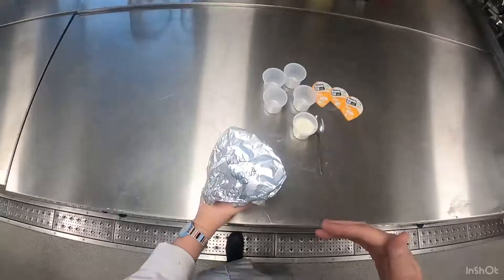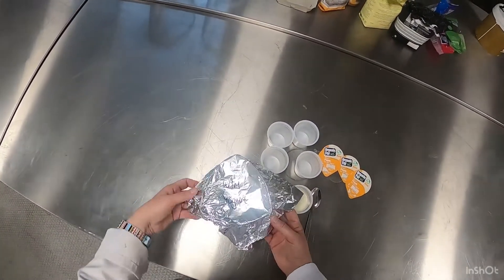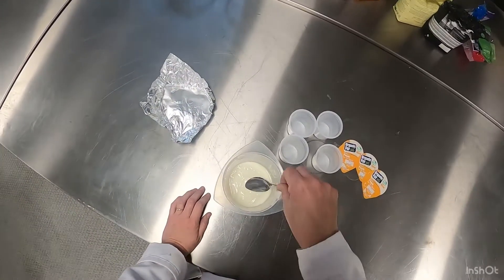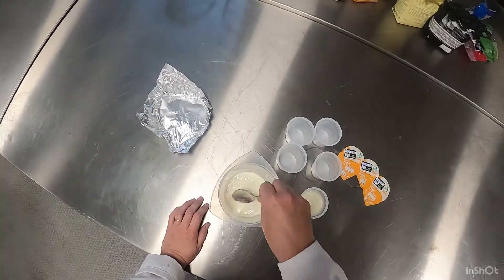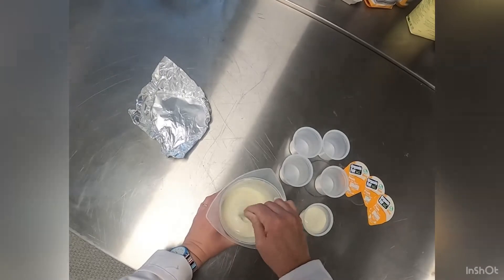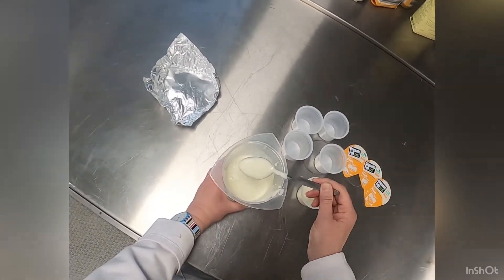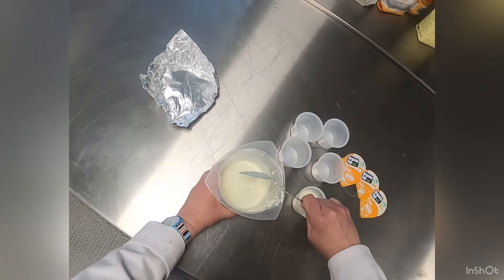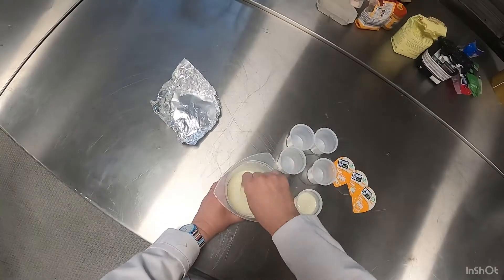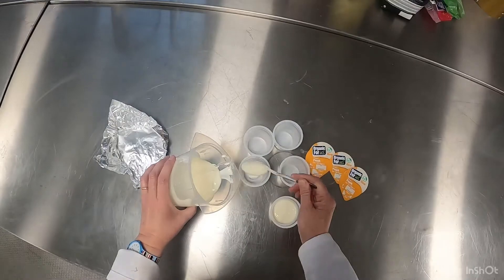You know it's yogurt when the pH has reached about 4.6 and below. I checked it earlier and we were sitting at 4.5. When you want to work with yogurt, you always work with it when it's still warm. I'm going to give it a nice stir — you can see there's a lovely sheen to it, no bits, and a really good yogurt smell.